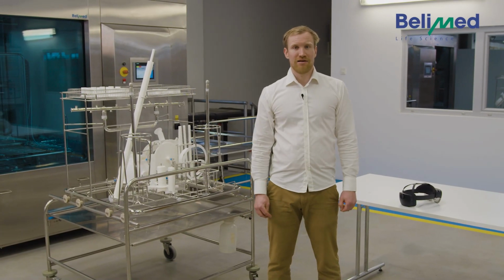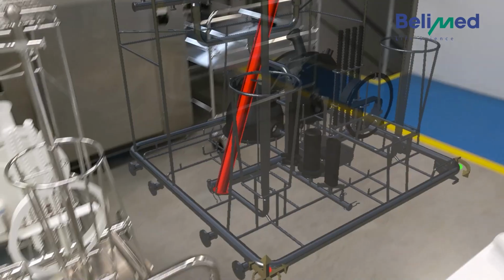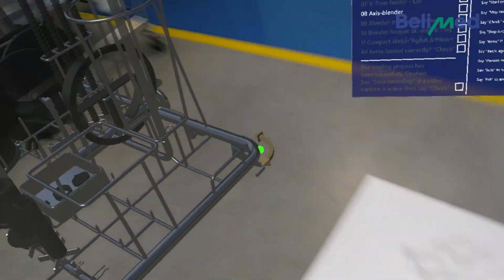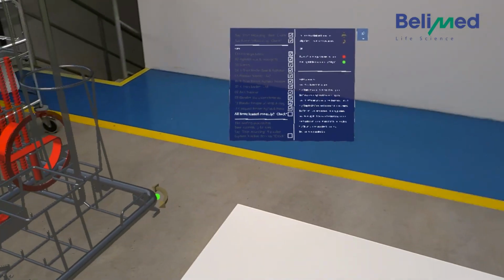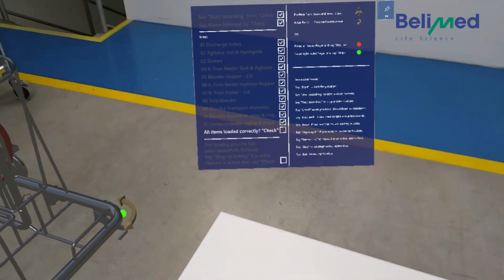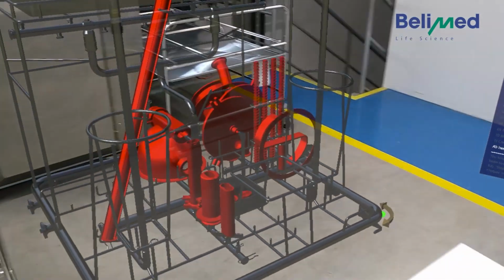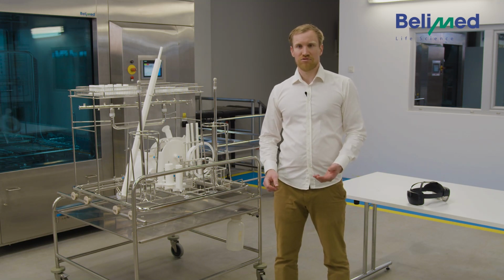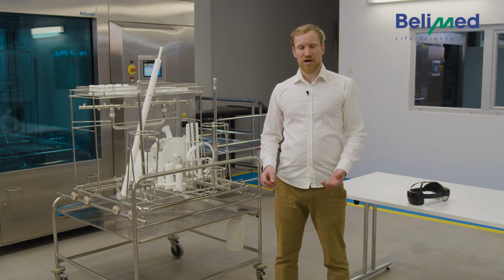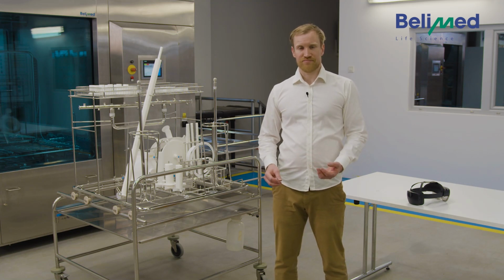As you can see, loading a rack with the mixed reality glasses is really simple. You just put them on, start a program, and then just follow the guidance of the program. And so, step by step, the wash goods are assembled on the rack. There are a few benefits. The first is, it's really easy to use, and especially for trainees, they learn in a really simple way how to load such a rack and what the important things are.